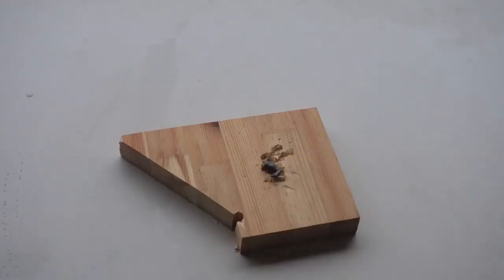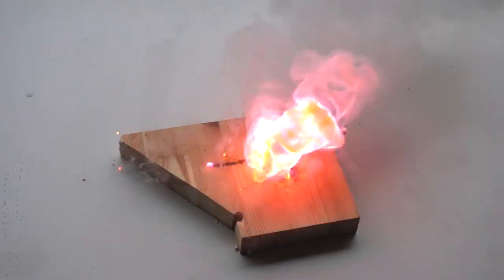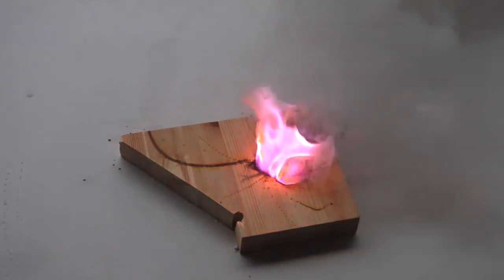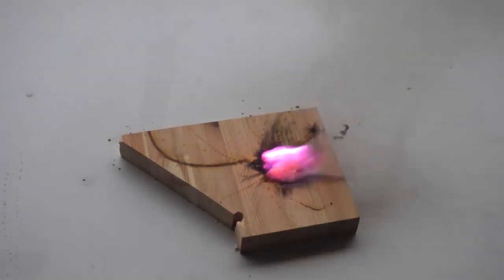First, I took a piece of cesium and put it on a piece of wood. Cesium melts from the oxidation reaction of oxygen in the air and then self-ignites with a beautiful magenta flame due to cesium ions.